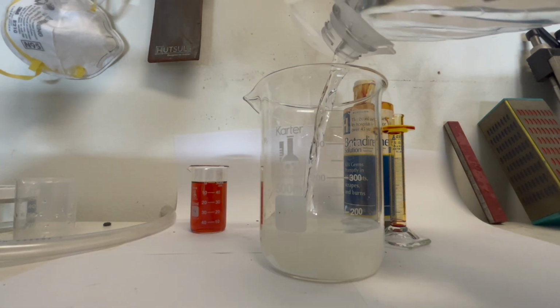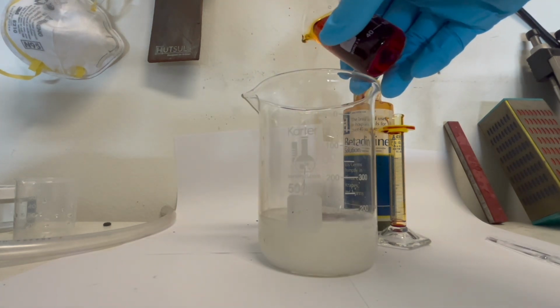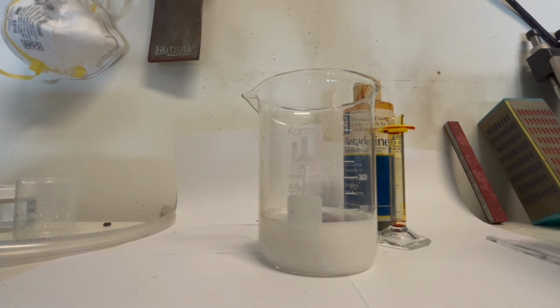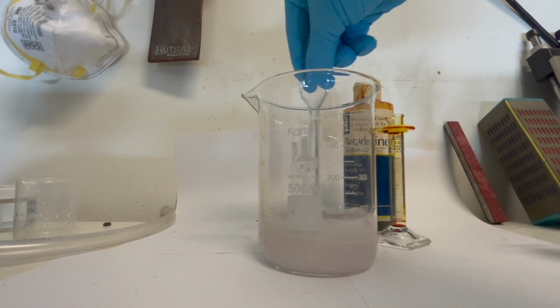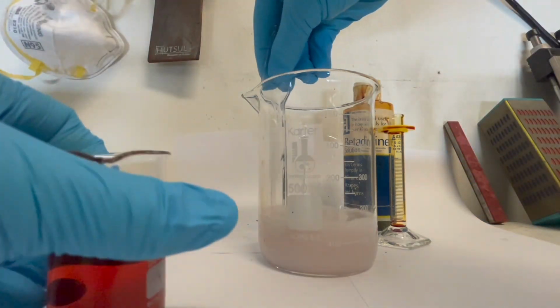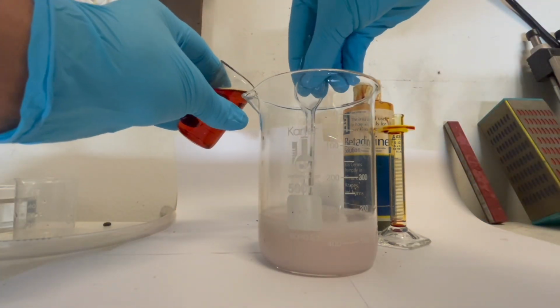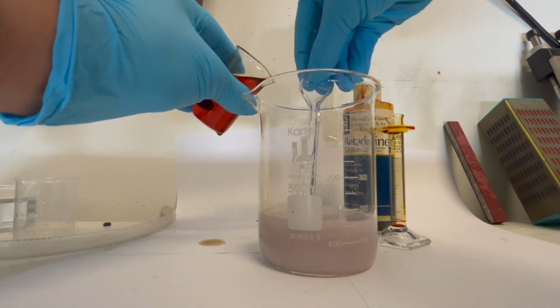As the triiodide ion slips in between the starch coils of the amylose, it quickly forms a blue-black complex, the starch complex that we saw earlier in the diagram, which is black. I begin to add more of the solution, and you can see that a black color begins to form inside a large beaker, which indicates the presence of starch.